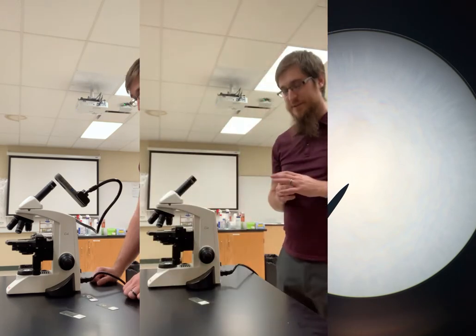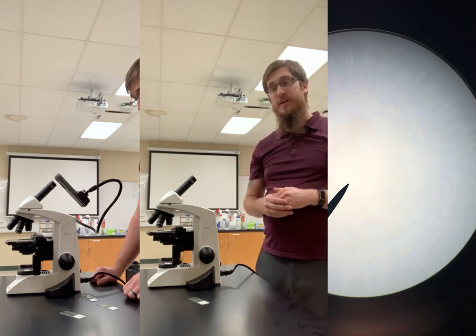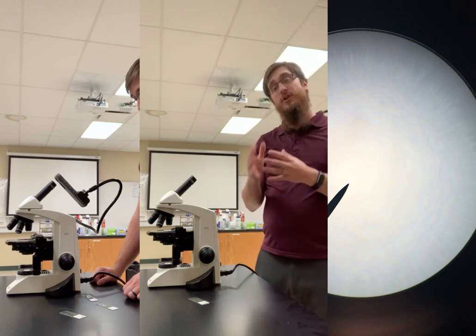Hey again, I forgot to mention a couple things in the last video, so I'll just add them in real fast here. When we're looking at stuff under the microscope, most of the times the items that we're going to be looking at are going to have color to them.